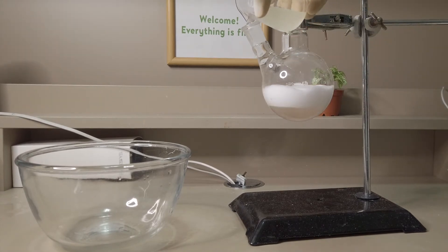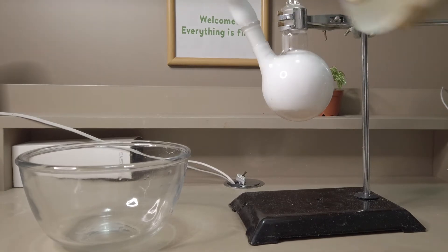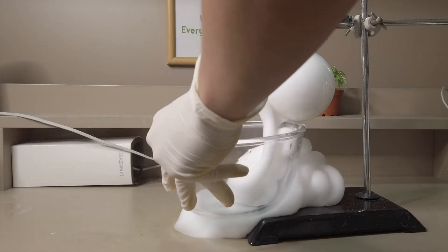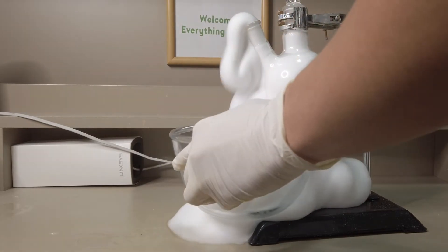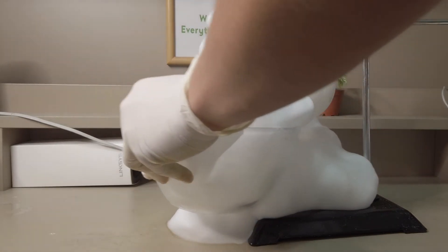Immediately a large amount of foam rushed out of the flask. Obviously I did a really bad job in calculating its projection distance and a worse job in predicting the amount of foam that's being produced.